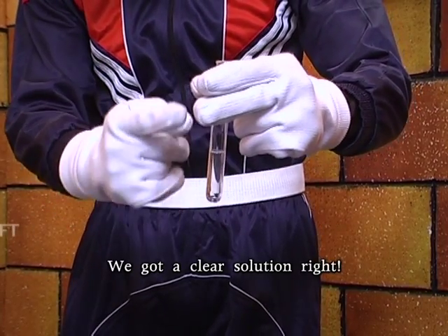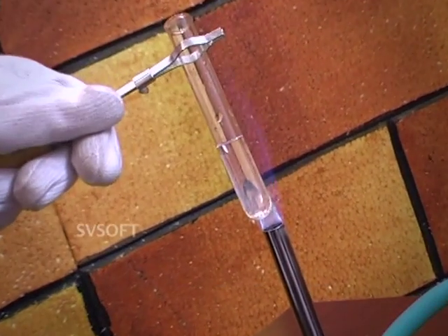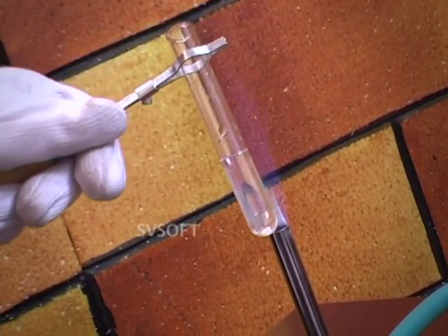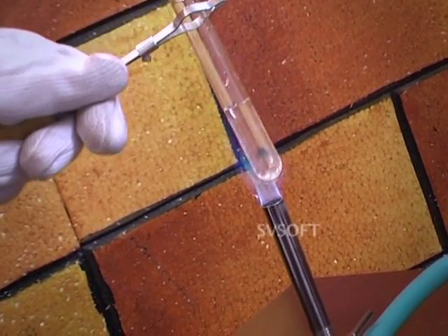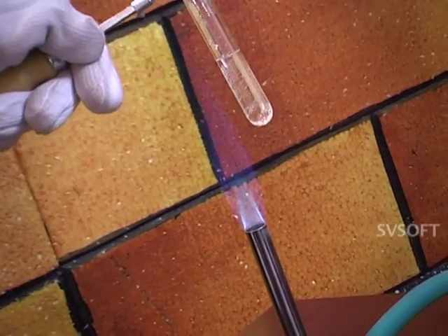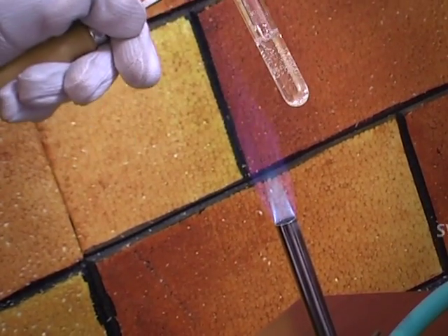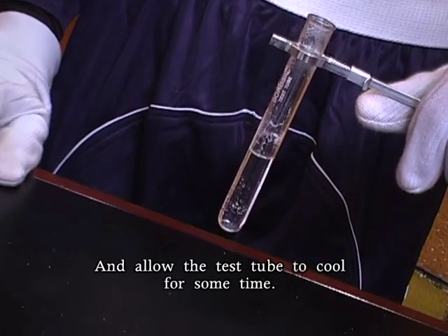We got a clear solution, right? Heat this mixture on the Bunsen flame, and allow the test tube to cool for some time.